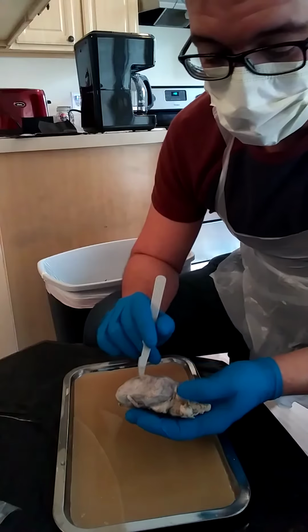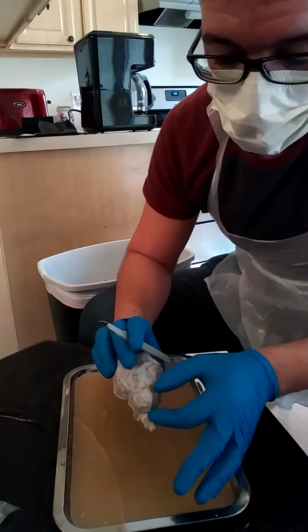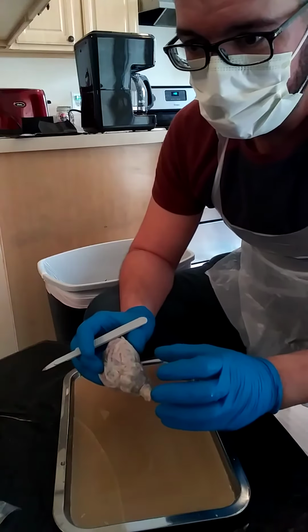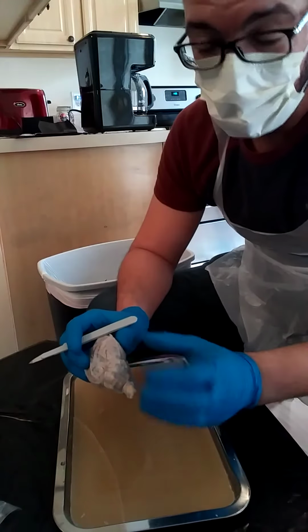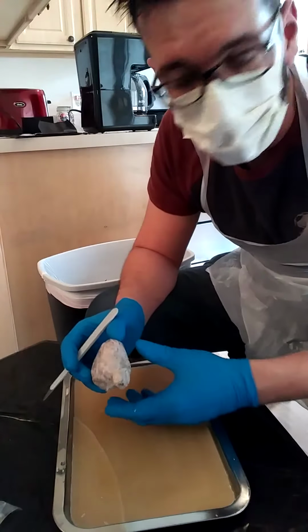The occipital lobe is the very back of the brain. It's this part right here. This part right here is the cerebellum. It's a little bulby part that's usually beneath the two lobes of the brain. For some reason in sheep, I guess, it's just further extended out. So, go figure.